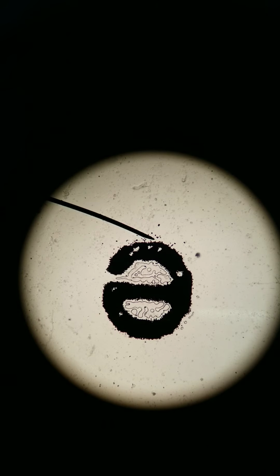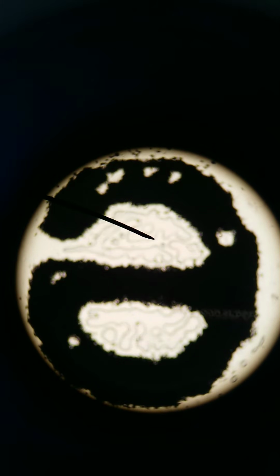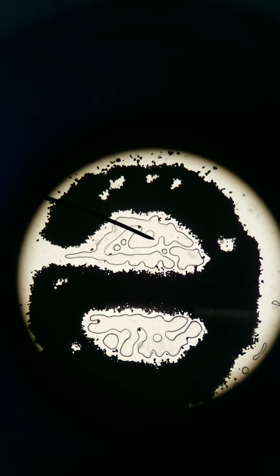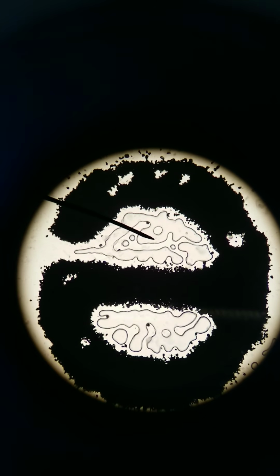It's in focus right now, so I can switch this to the 10x low power objective, and we can see how it fills the screen, our field of view. We need to adjust the focus a tiny bit, but at this point we don't need to use the coarse focus anymore, just the fine focus. The term for this, that the microscope can be switched from objective to objective without changing the focus that much, is called parfocal. Alright, so I'm going to change the fine focus, play around with that, and that looks like it's in focus there. Cool. So yeah, our letter E takes up pretty much the entire field of view at a total magnification of 100x.